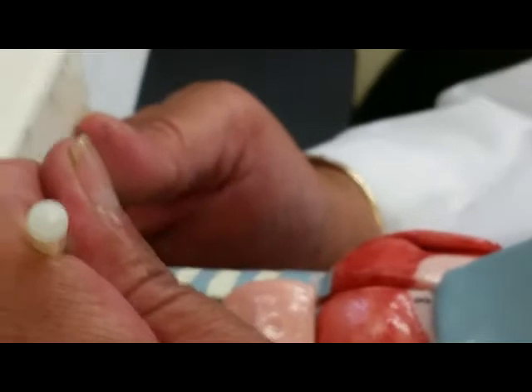Here is the trachea, and the trachea has rings. So in blue, and the question will be specific, this would be the cartilaginous rings. If I go across, I'm looking for the word trachea. If I stay on the blue, it's the cartilaginous rings. And now the trachea splits into two primary bronchi.